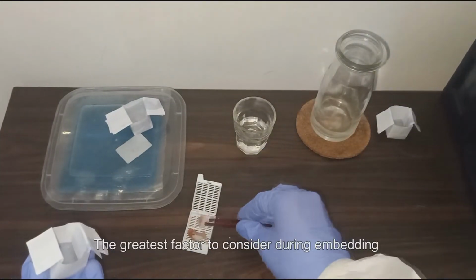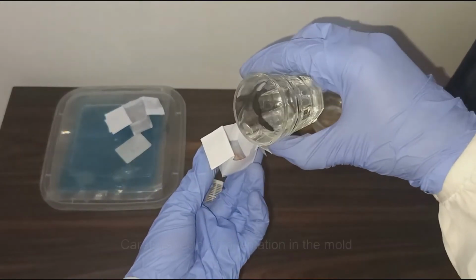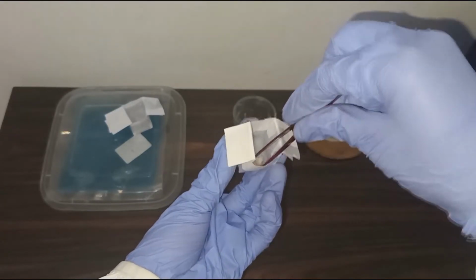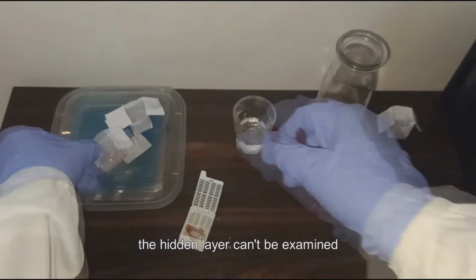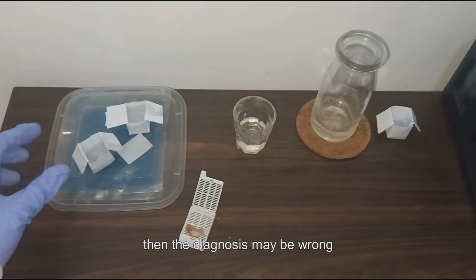The greatest factor to consider during embedding is the orientation of the tissue specimen. Careful specimen orientation in the mold determines the plane of section. If not all layers are exposed, the hidden layer cannot be examined. Then, the diagnosis may be wrong.